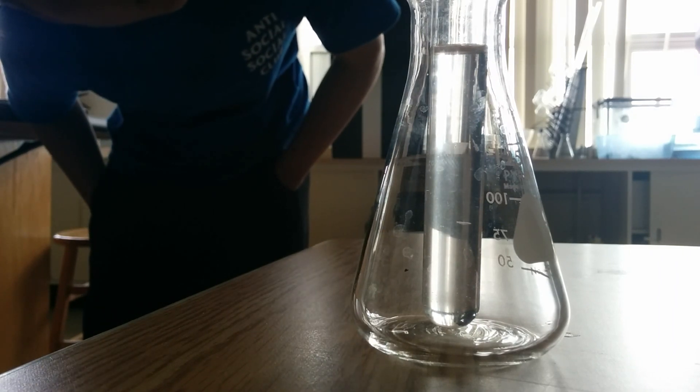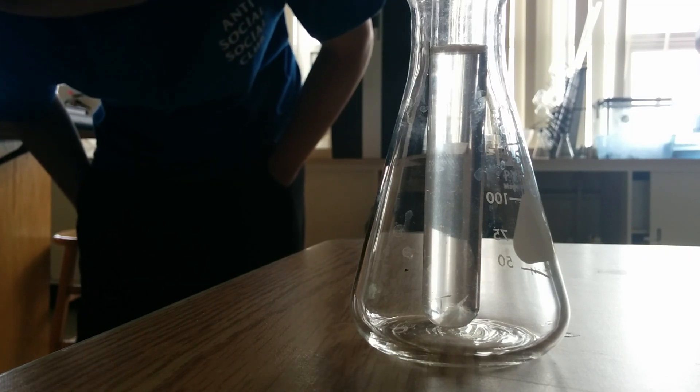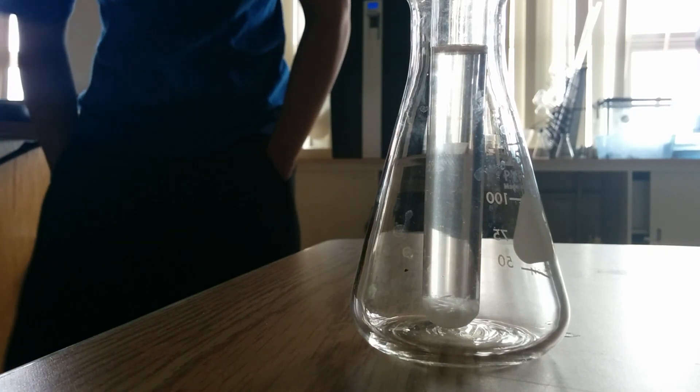We're going to wait patiently to see if they crystallize more aggressively. Nothing. Nothing. Well, oh, here we go. Finally, at the bottom.